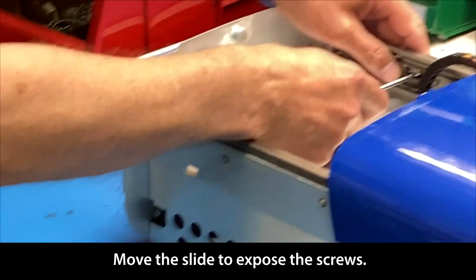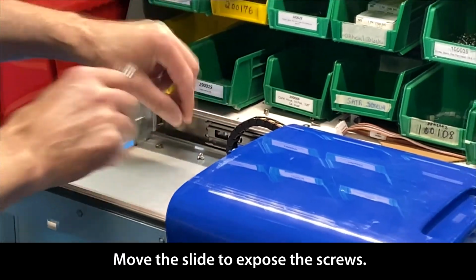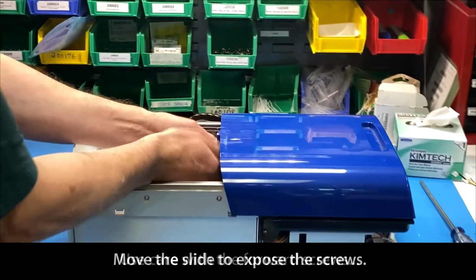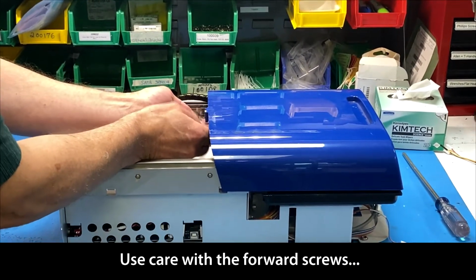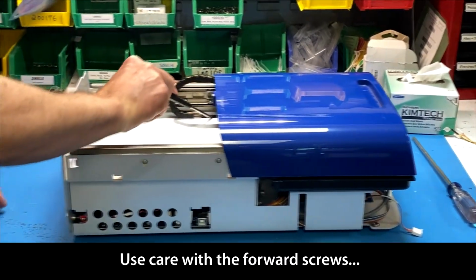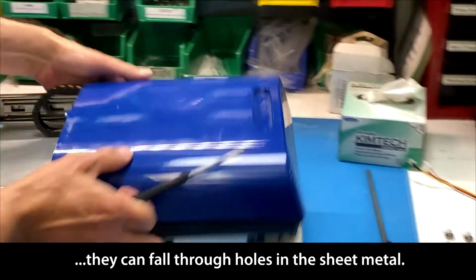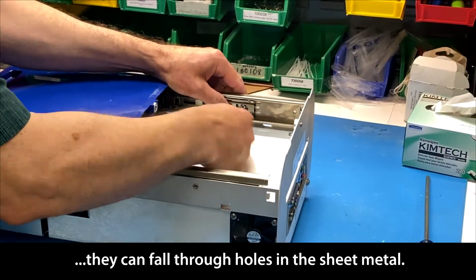So I'm going to take my Phillips screwdriver and take out these screws. On the ones in the front, you want to be careful because there are holes here that your screws can fall into. So just be careful when you remove those screws that you don't drop them in there.